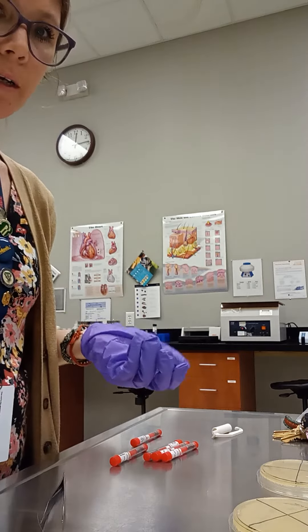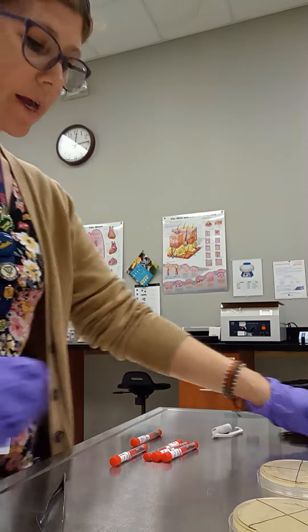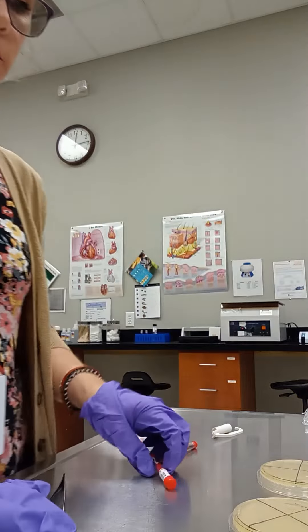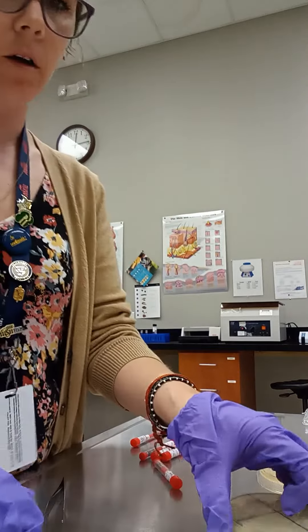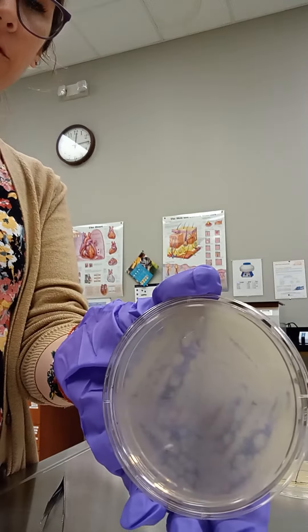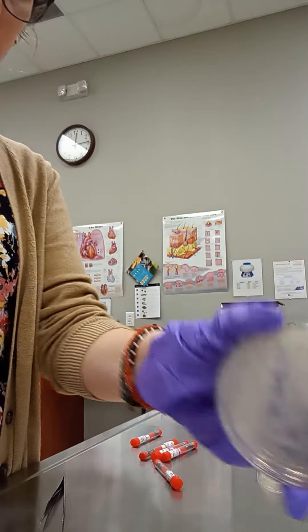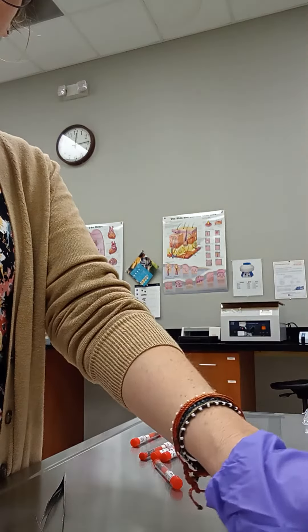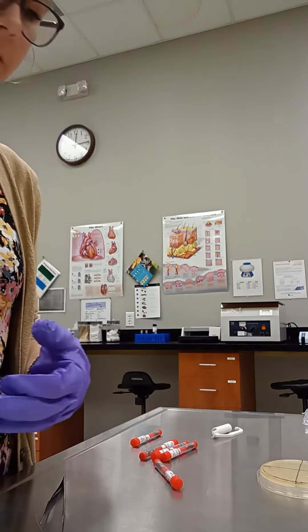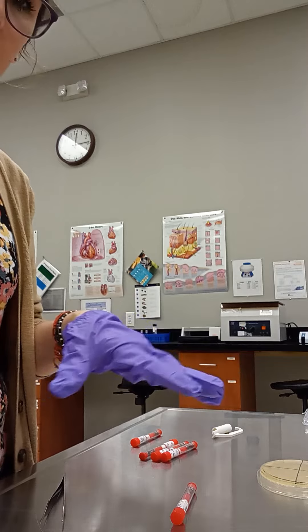Today we're going to place our antibiotic sensitivity discs onto our agar culture. We have our culture plates that have grown our bacillus, and the next step of the antibiotic sensitivity testing is to place one disc from each of these vials onto our plates.